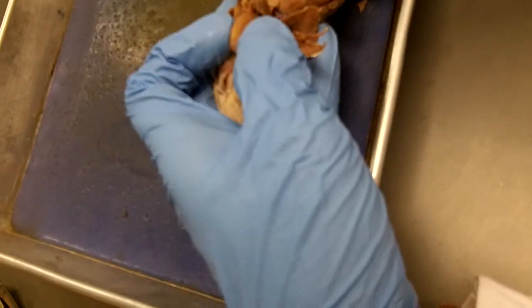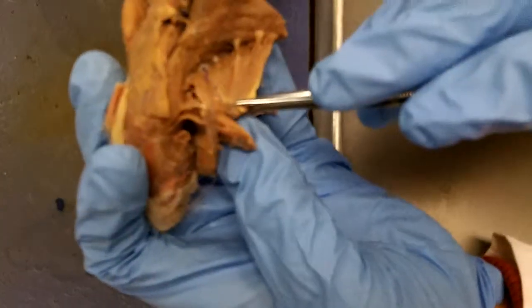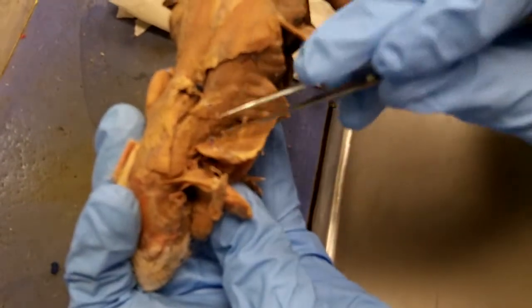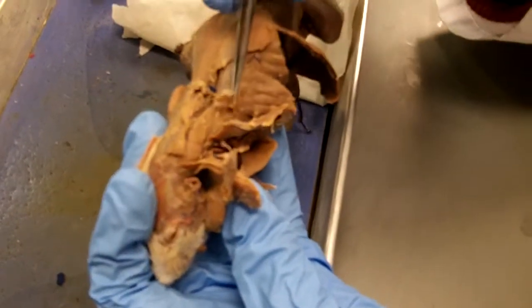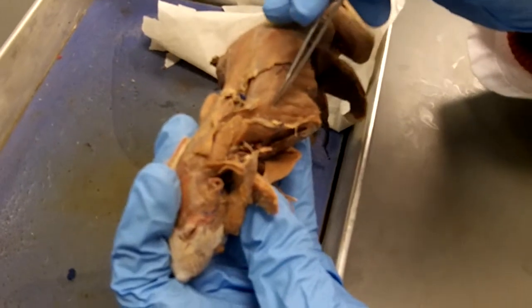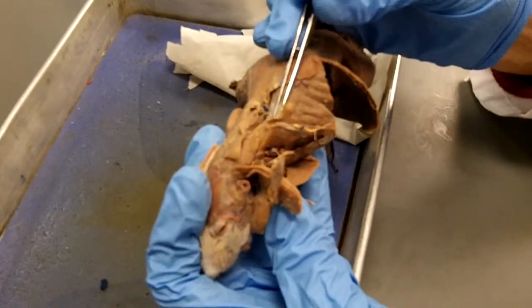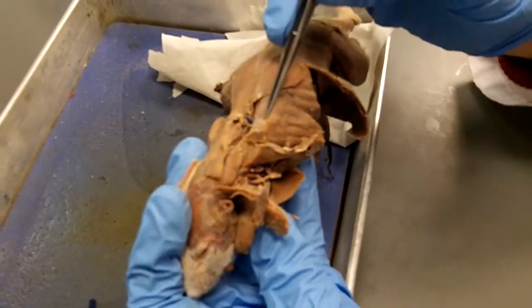We also have cut here this very large triangular shaped muscle, which was attached to the scapula, and which we could sometimes see if we look like that. And that's serratus ventralis. And now we pull that out of the way, then we can see another smaller, thin sheet of muscle that also has that sort of little wedge-shaped insertion, which is caused by attaching to separate ribs. So each of those little V-shaped notches is attaching to a separate rib. And this muscle here is serratus dorsalis. So this is serratus dorsalis, this is serratus ventralis.